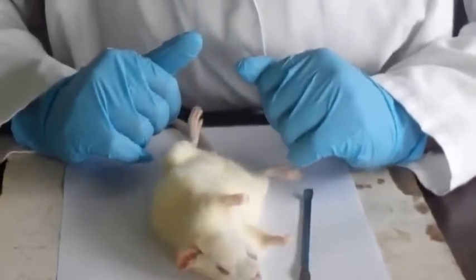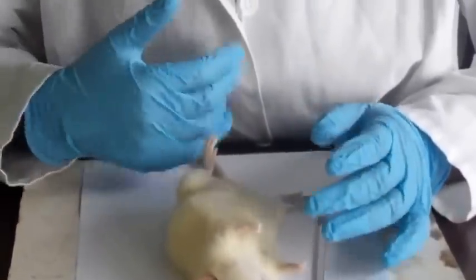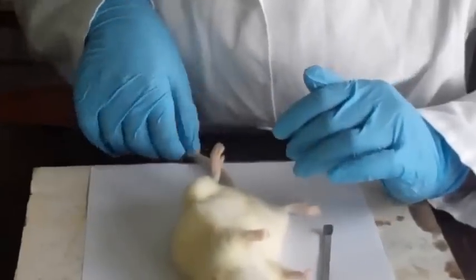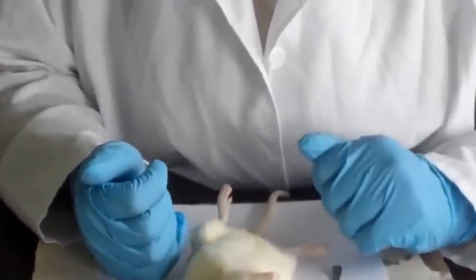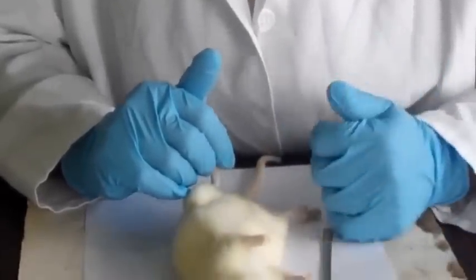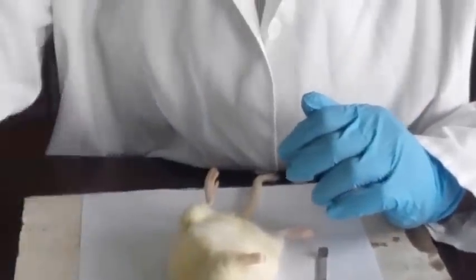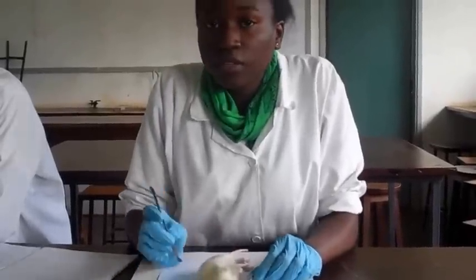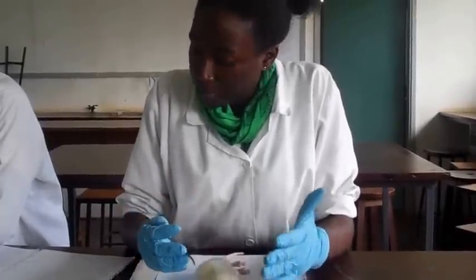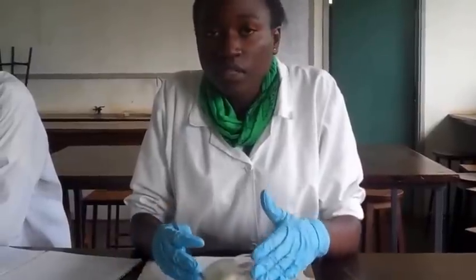of a rat. And then of course the tail in the posterior end. Those are the structures that we find, making the different regions of the rat. We're going to look at the descriptions and adaptive significance of these external features.